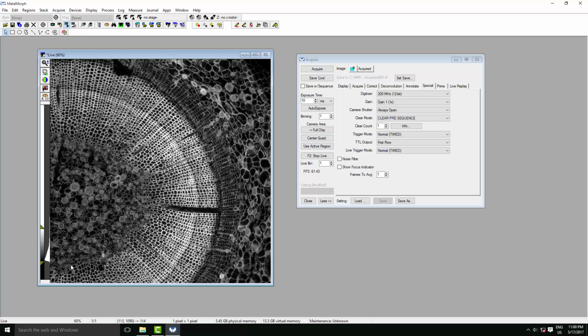So we have an 18.7mm sensor, meaning that we have a really nice field of view, and 11 micron pixels, which are perfectly matched to use a 100 times objective for maximum resolution. We've got an 80,000 electron full well, meaning that we can capture 80,000 different levels of dynamic range. This is huge compared to an EMCCD. And finally, this camera can run at 82 frames per second full frame, or 41 in our higher dynamic range mode.